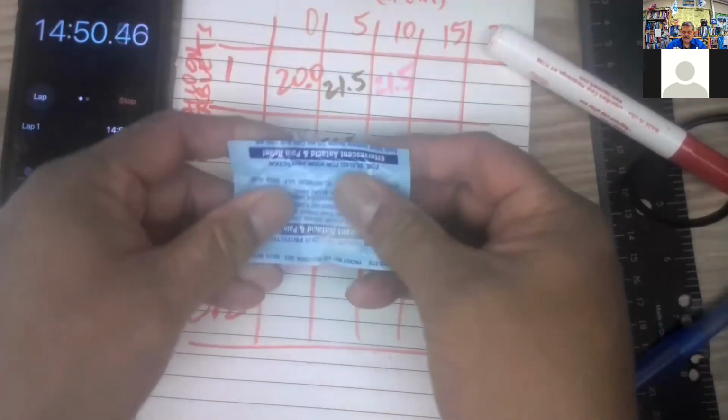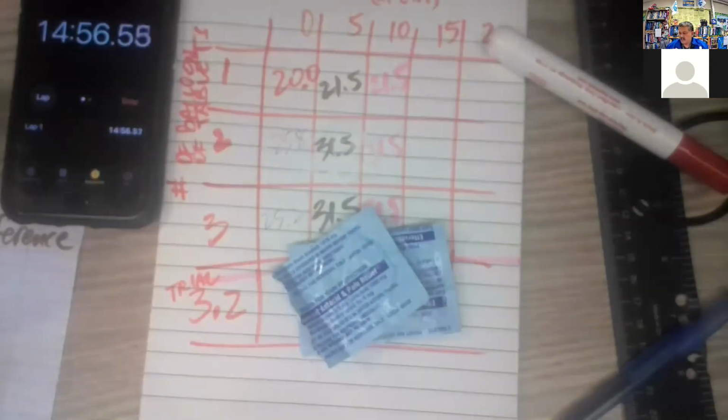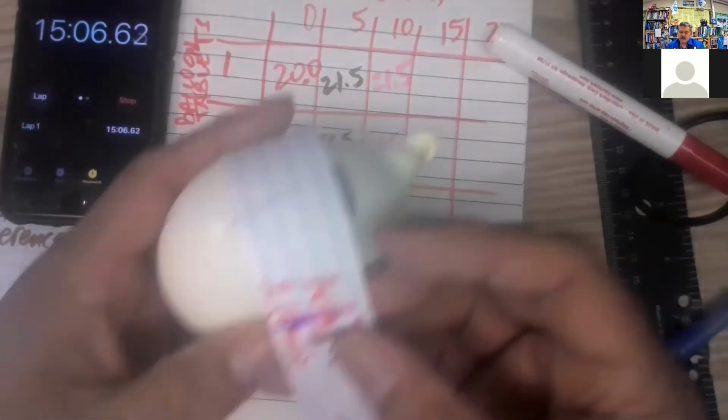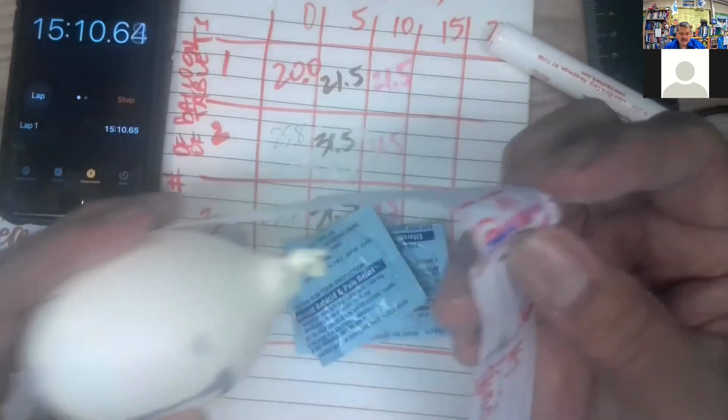That going. So we're crushed, ready to go. Well, let's make our measurements at 15. So here's my fancy paper measure. Number one, same. Okay. Number 2.